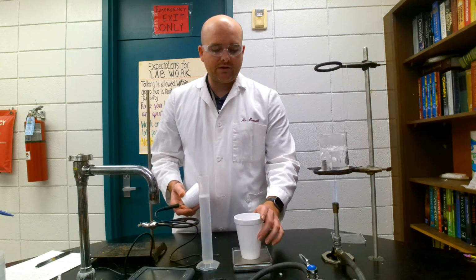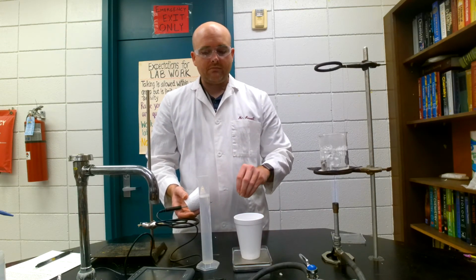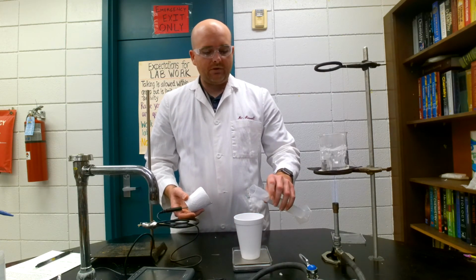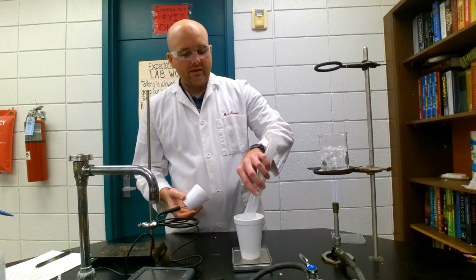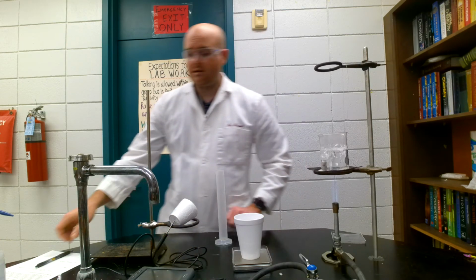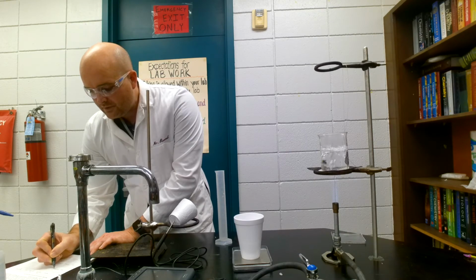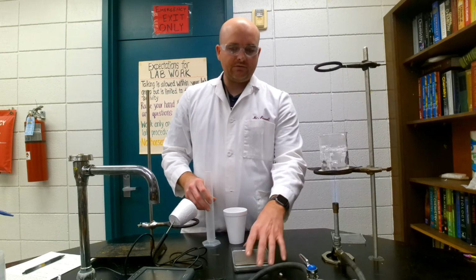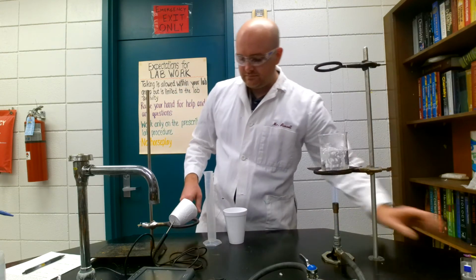So let's go ahead and make sure we get an accurate and precise mass of our water. So we'll take this and I put it in the cup. And the mass of our water is actually going to be 99.62 grams. It's pretty sweet, Mr. Russell, right? 99.62 grams. So I won't need this balance anymore. I'm going to put this off to the side.